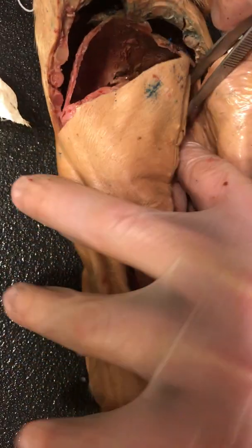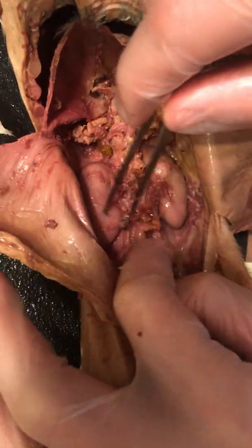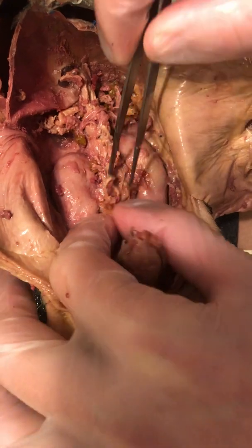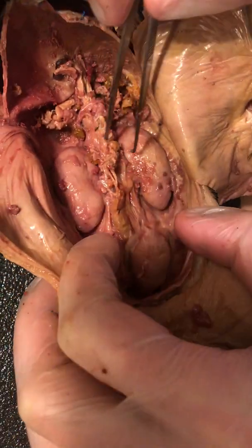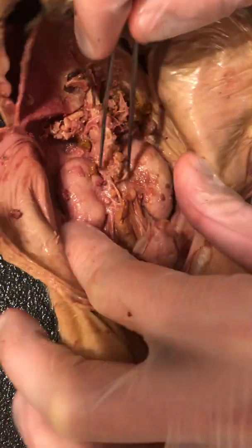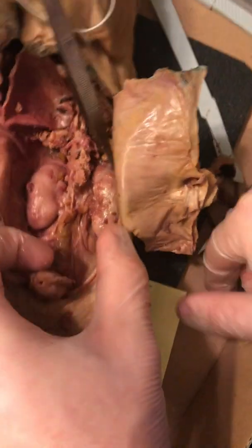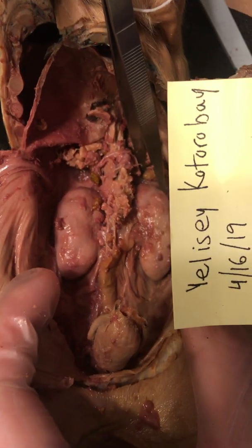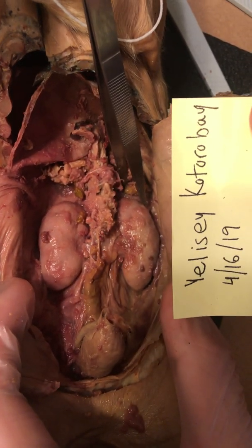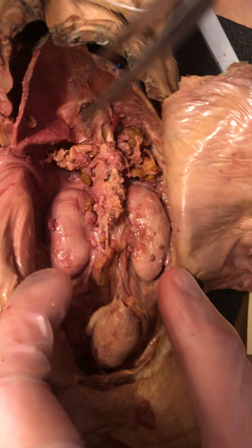So there is some connective tissue here, but I'm afraid if I remove it, I'll be ripping blood vessels. So, okay, there we are. So the second image without the membrane, we're going to have right here. Let me grab my shot. Okay. We've got our second image there.